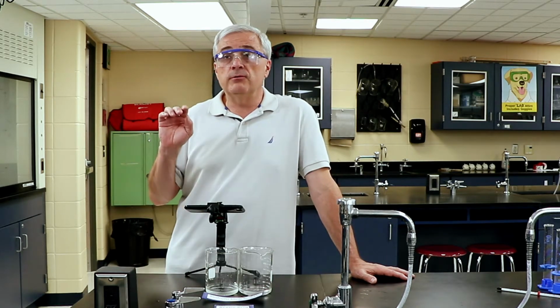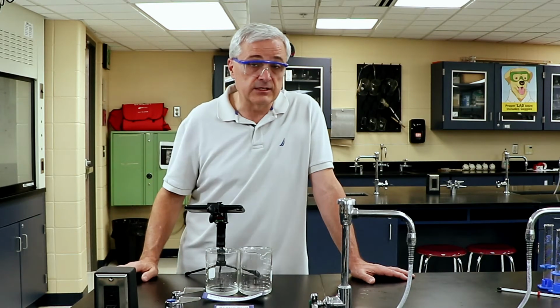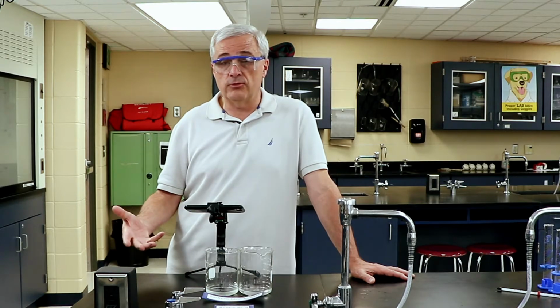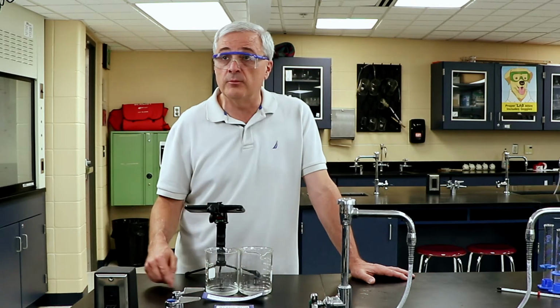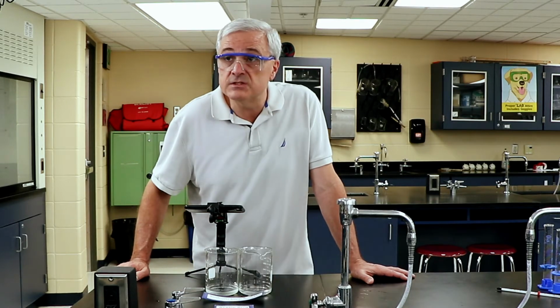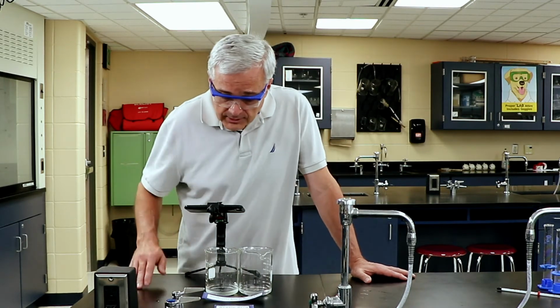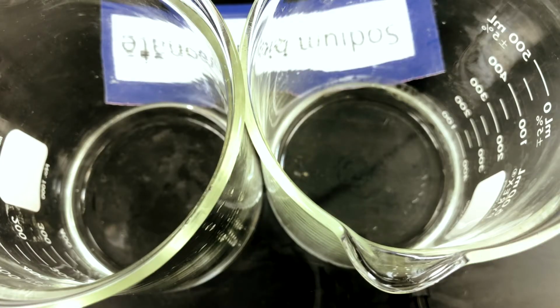So we're going to assume that the hypothesis is correct. The guess was that the colder the reactant, the slower it would run, and the data supports that. There are still bubbles forming. It is now 4 minutes and 30 seconds, and it is still forming bubbles. So the hypothesis can be accepted. And so we want to state in our conclusion that, based on the data that was collected, the hypothesis can be accepted.